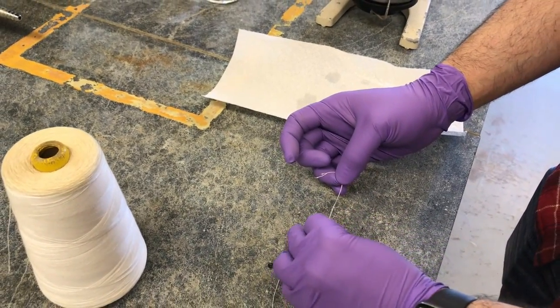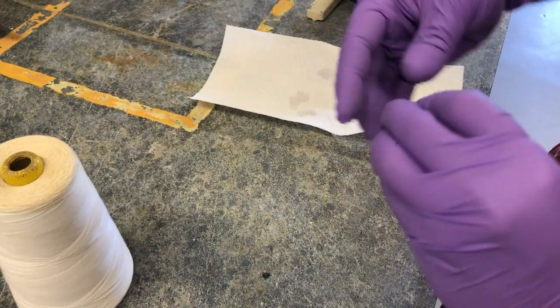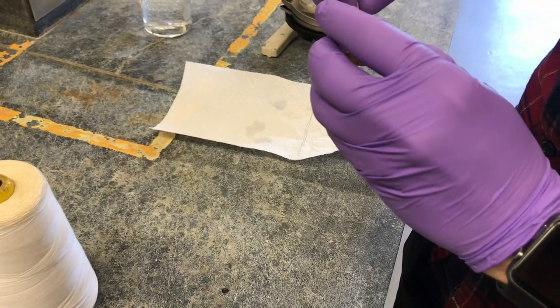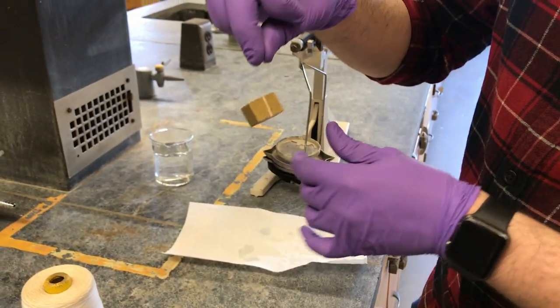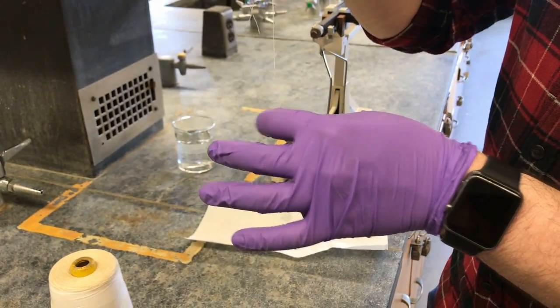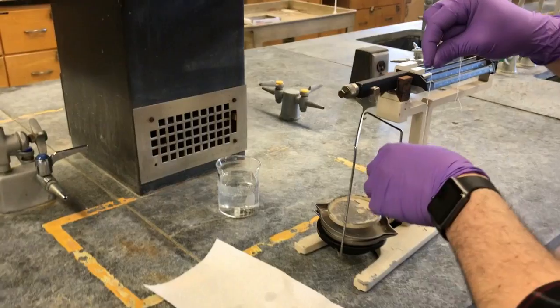So you'll pull it like so. It doesn't matter if you use this method perfectly, as long as you get it securely tied. Yeah, like I did now. Perfect. You could also just try to tie it to the best of your ability, but eventually what you'll want is something like this, where the solid is floating in air. It doesn't really matter that it's spinning, because it'll eventually just stop.